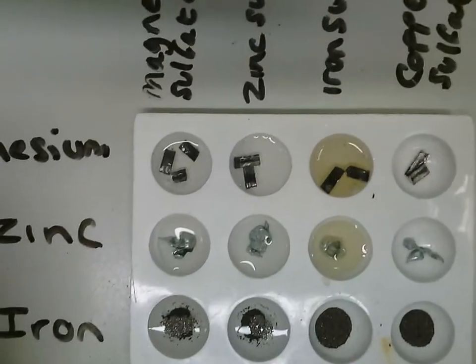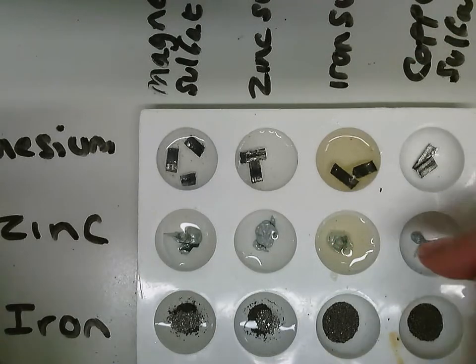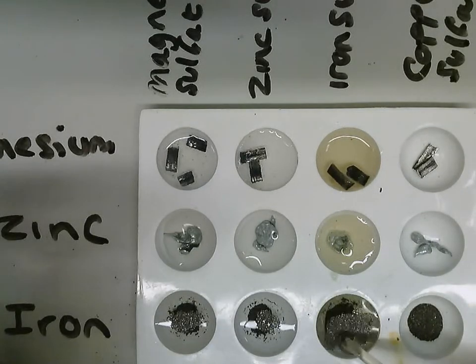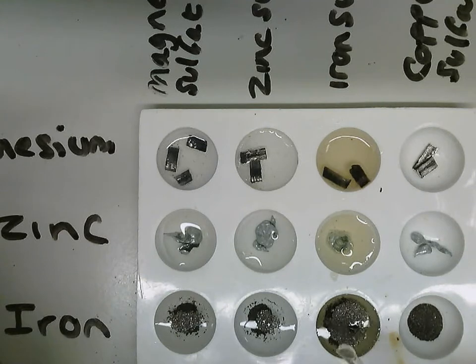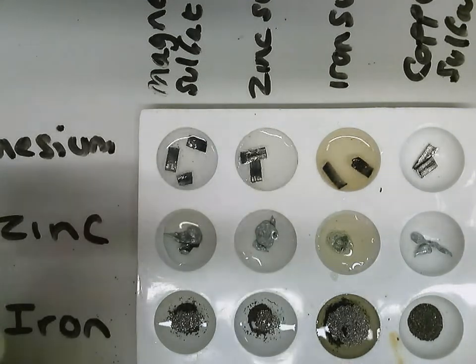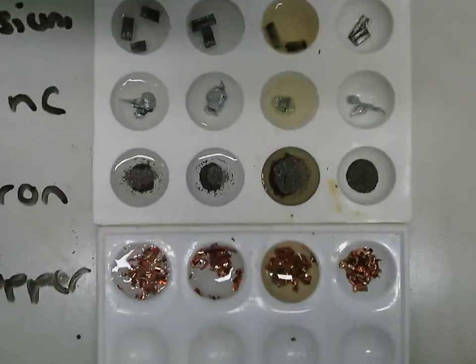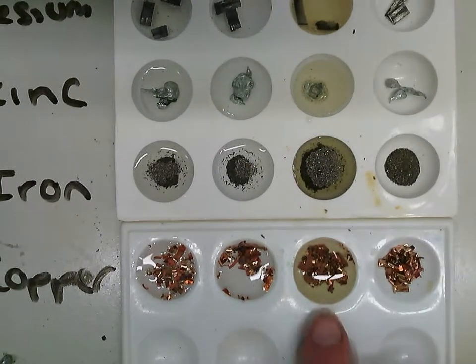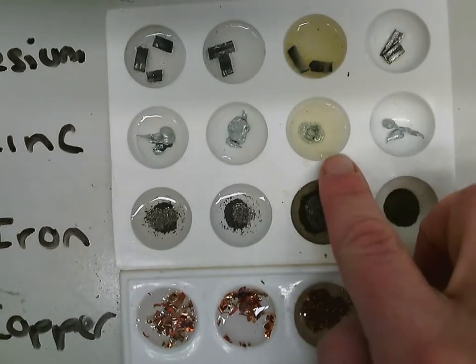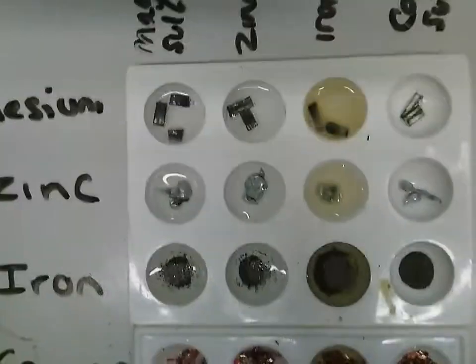So if we're going close, you can see this one's going quite violently. It's actually getting really hot. You can feel the heat coming off it. And this one, you can see there's some slow bubbles. With the iron and iron shouldn't react because they are the same thing. I'm putting it in the copper. Copper again hasn't reacted with it because copper is not more reactive than zinc. You can see no reaction on that one, no reaction there. Bubbles forming around this one, and this one's quite aggressively reacting.